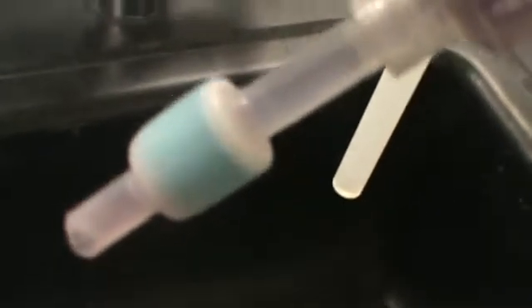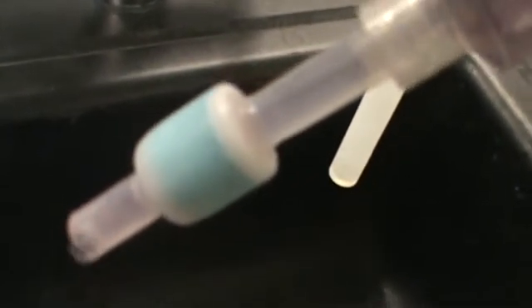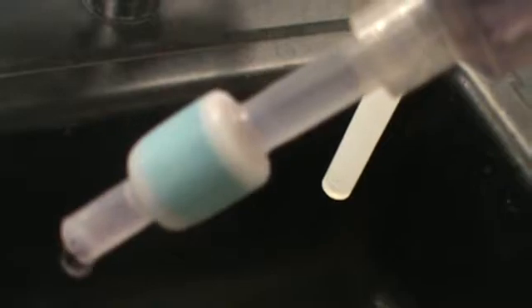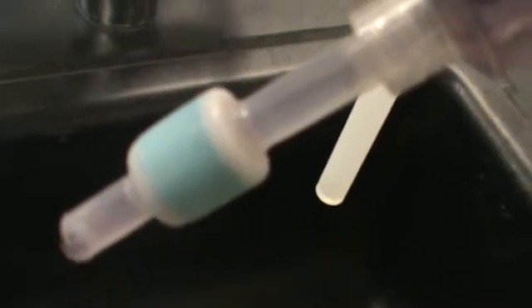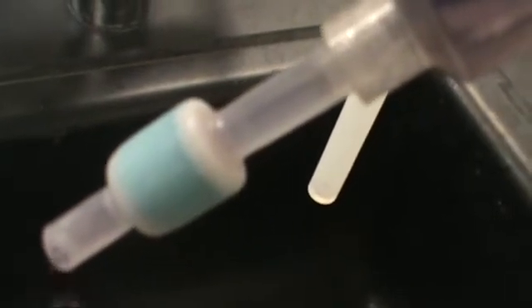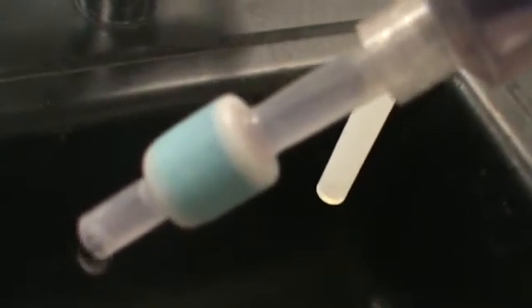What's going to happen is it's going to separate based on the polarity of the material inside the cartridge as well as whatever I'm flowing it through with. In this particular case, the red has already begun to flow through and the blue is caught.